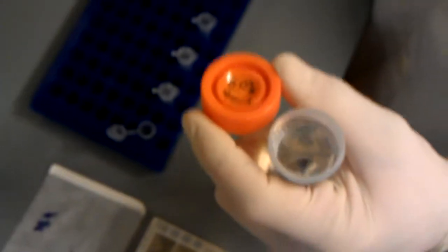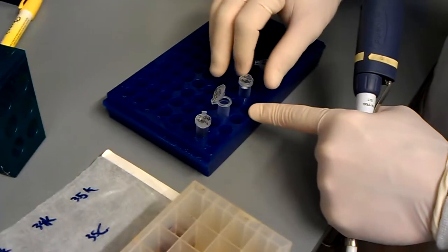And that's if we were doing one. Now, since we're doing more, we can actually be a little bit more efficient with our tips. We've already done this one. So what I'm going to do is just open all three of these and remember what is what. So we have 7035K, 7034C, 7035C.